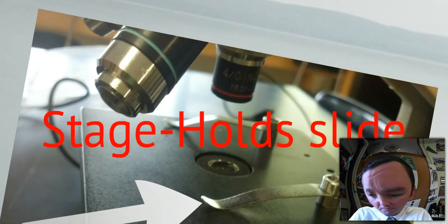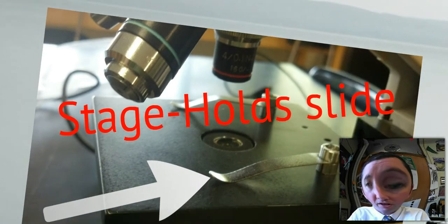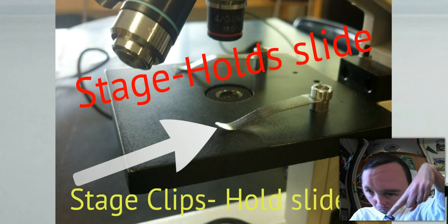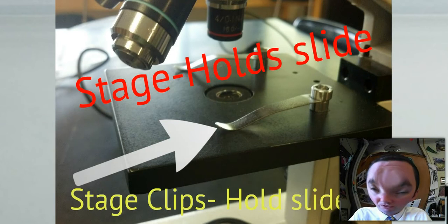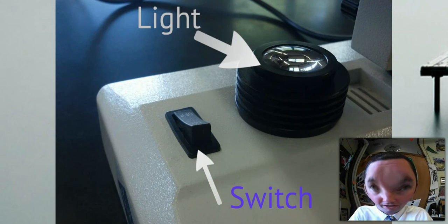Okay, you have the stage, the big gigantic black flat surface. That's where your slides go on. Right, this is the surface that will actually mount all of your slides. To hold them there, we use the stage clips. All right, the stage clips hold the slides in place. You make your life a lot easier. If you don't use the stage clips, if you even just slightly bump the slide, forget it. You're missing what you're actually supposed to look at.